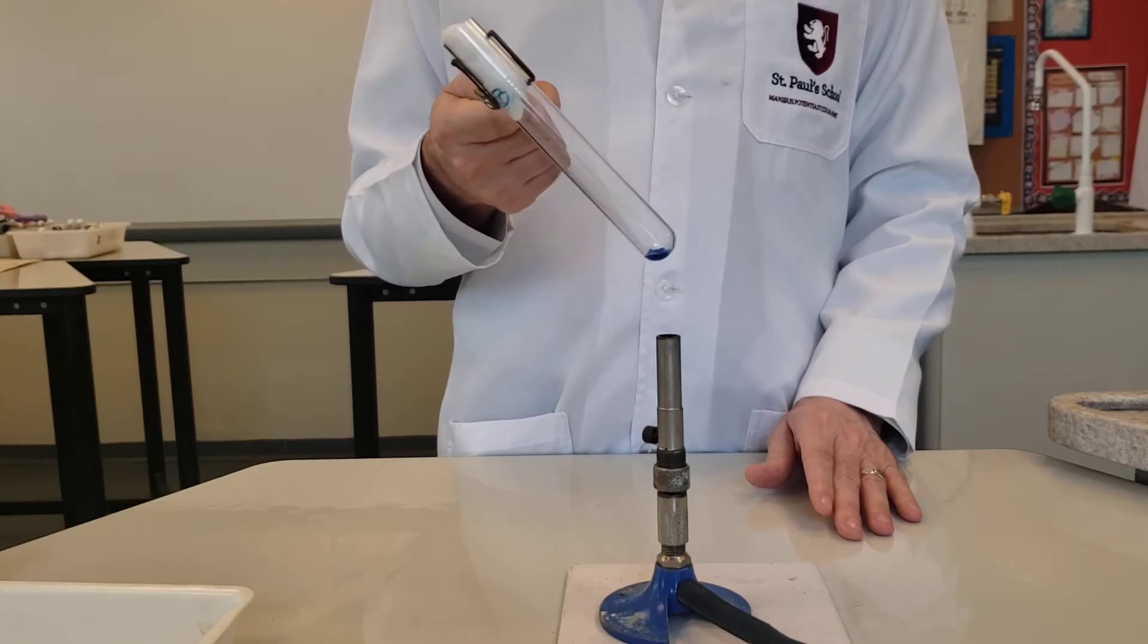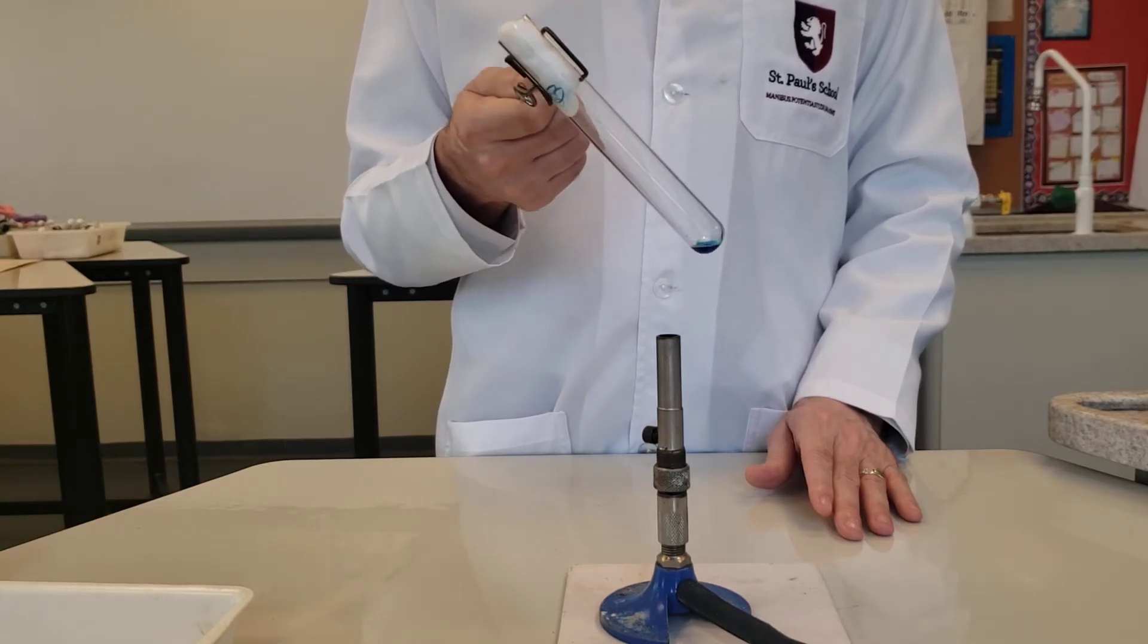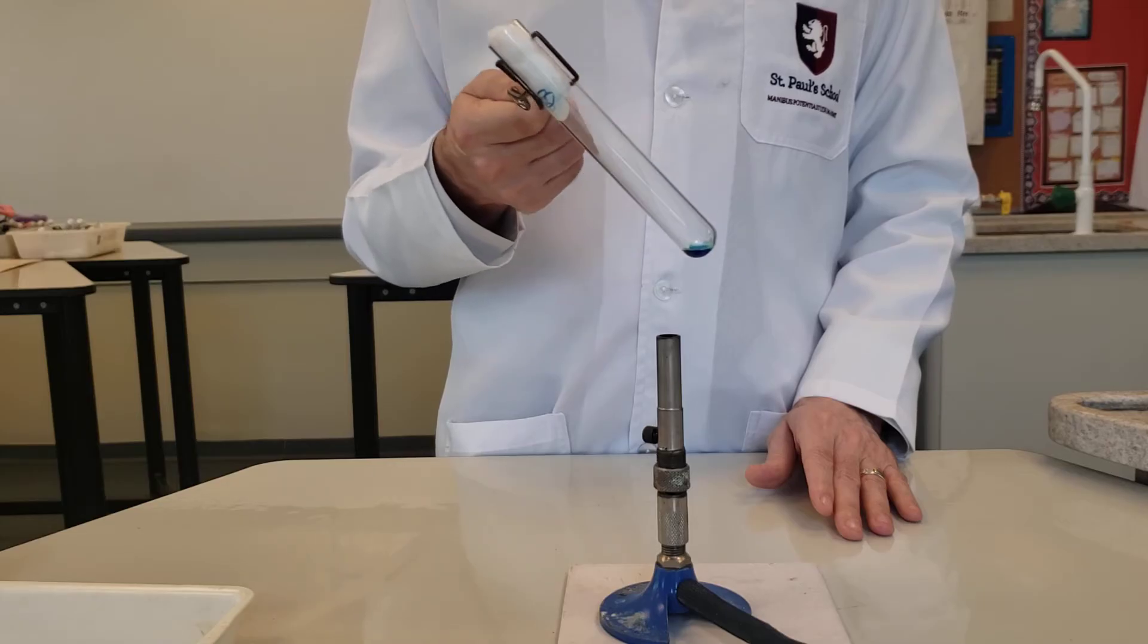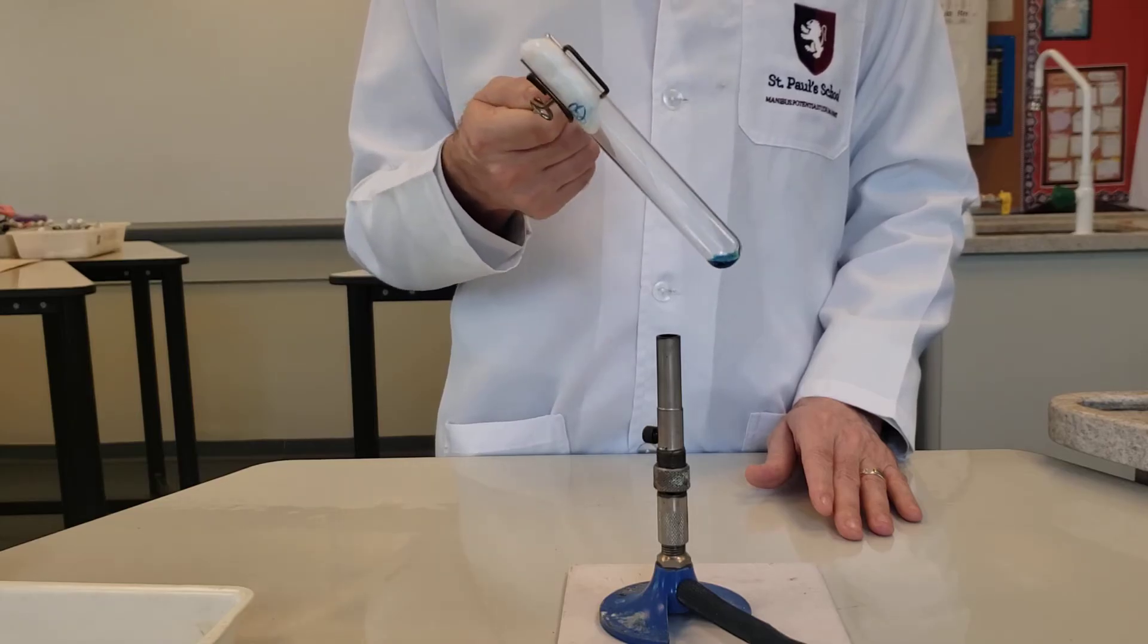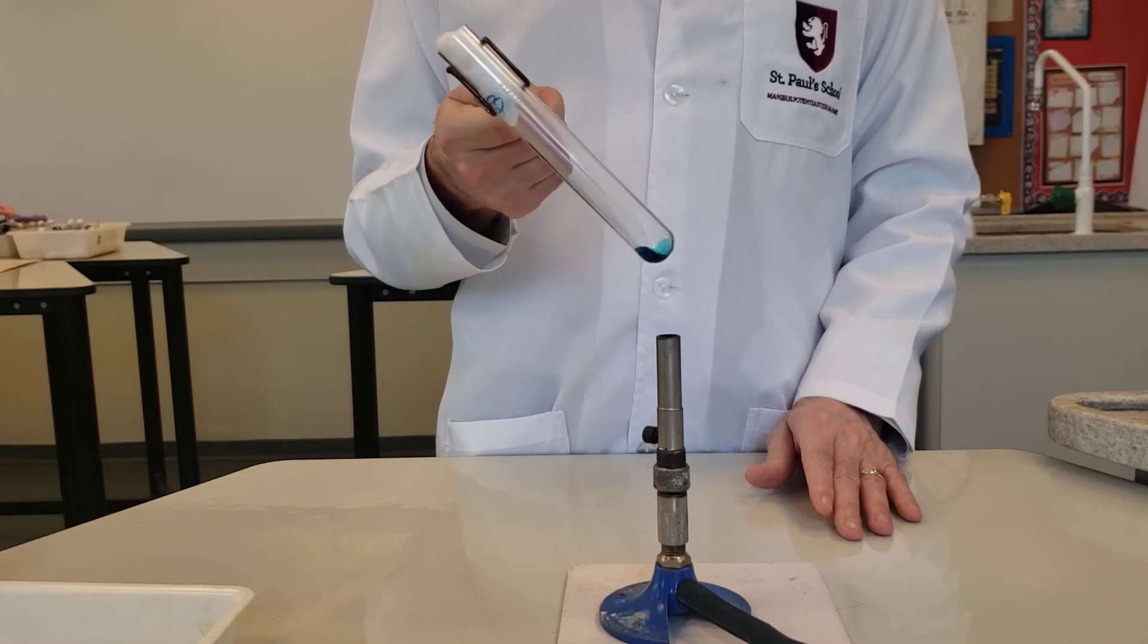Straight away you can see that it looks like the crystals are melting, but actually what's happening is the water is coming out of the crystal.